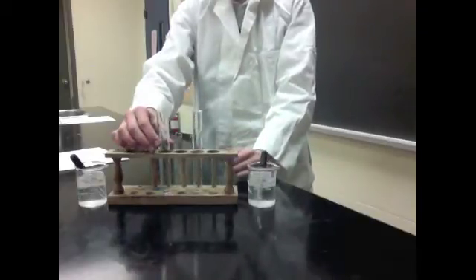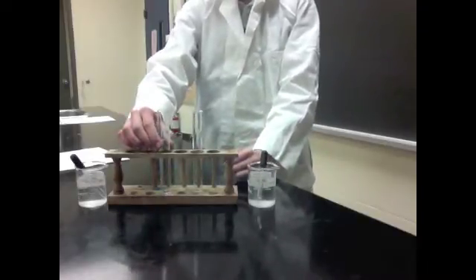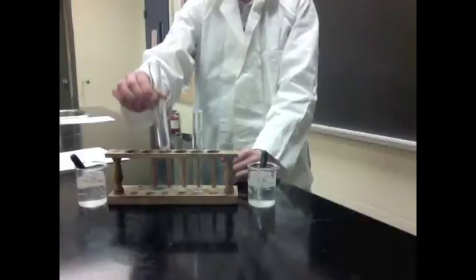Now we're going to pour one test tube into the other test tube and observe the reaction.